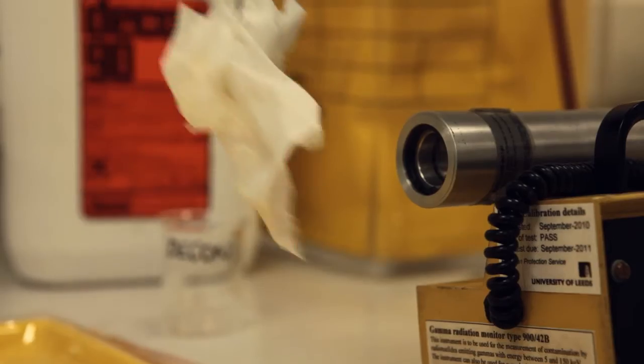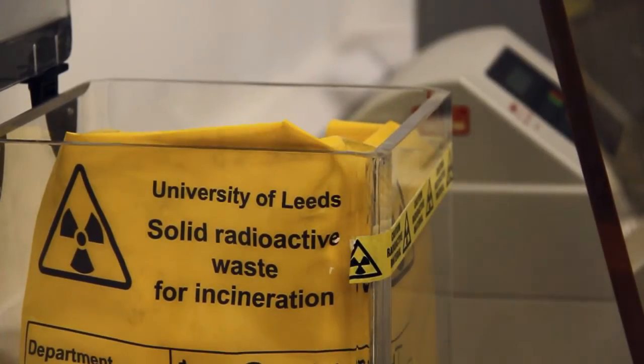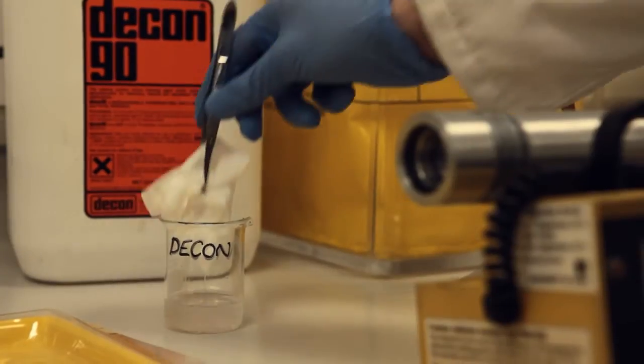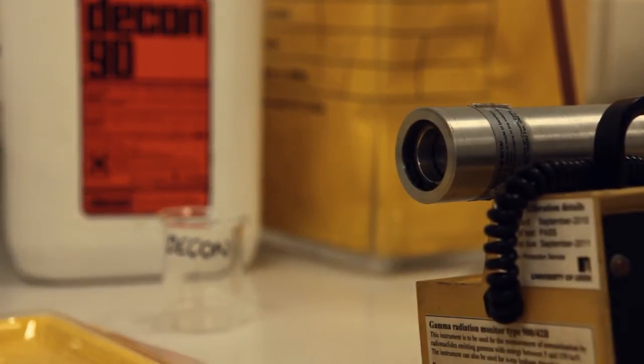He presents this tissue to the monitor which detects a high level of contamination. He repeats this process with less contamination detected.